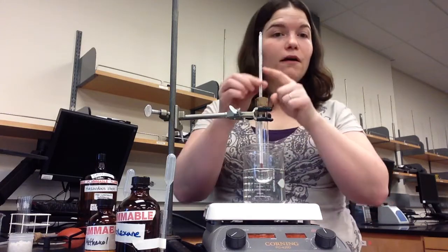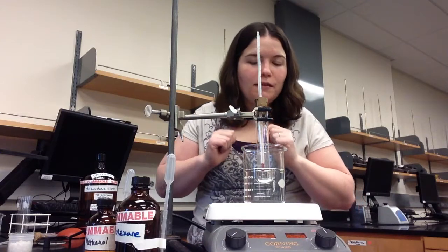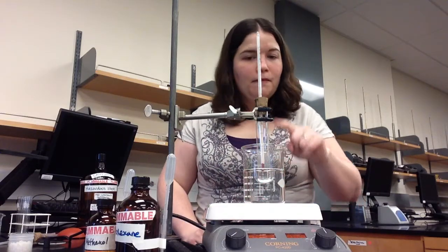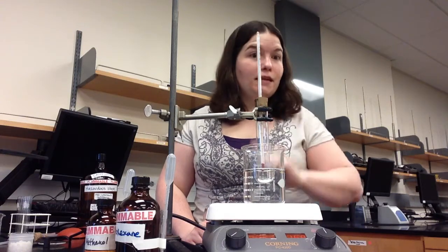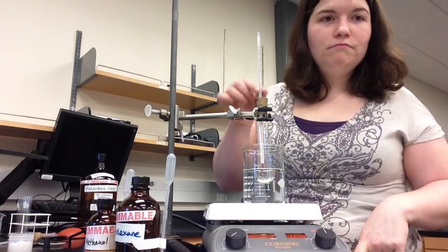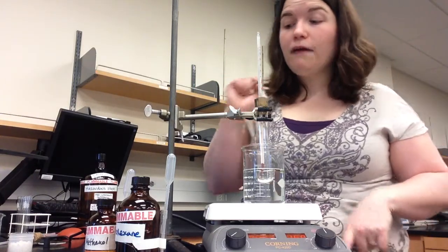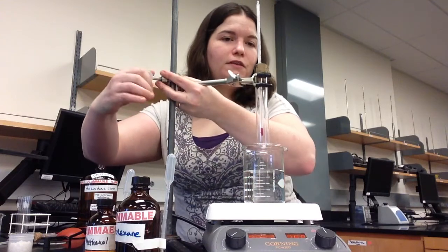You will then carefully monitor the temperature as it goes up and make observations about what is happening to the liquid inside your test tube. When the bubbles are forming a constant stream, that is the boiling point of your unknown liquid, and you can record the temperature in your lab notebook. After your liquid boils, move the test tube clamp out of the water so the liquid stops boiling.